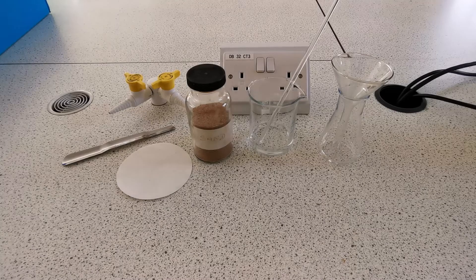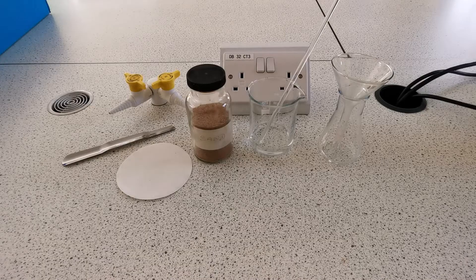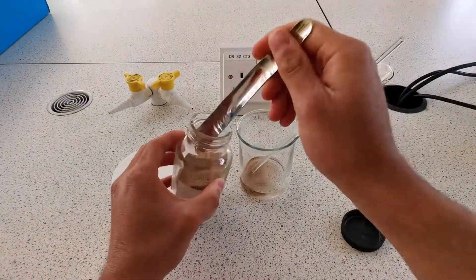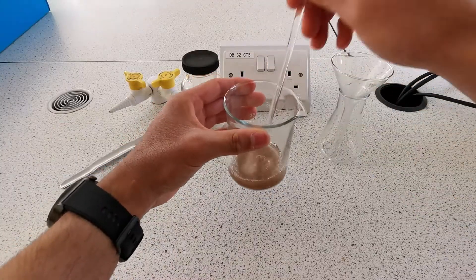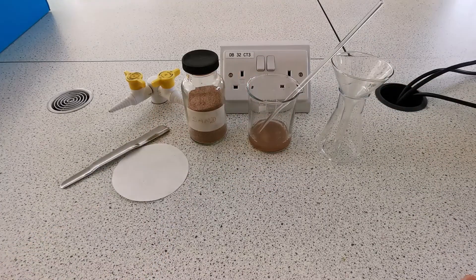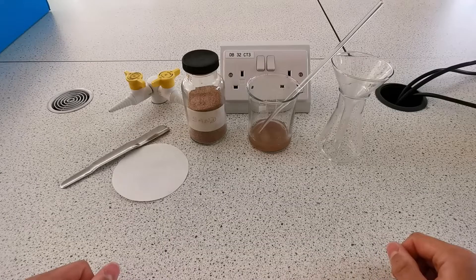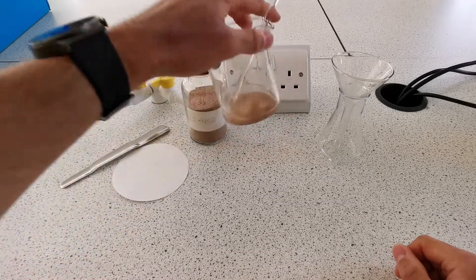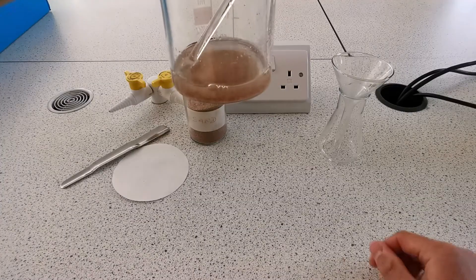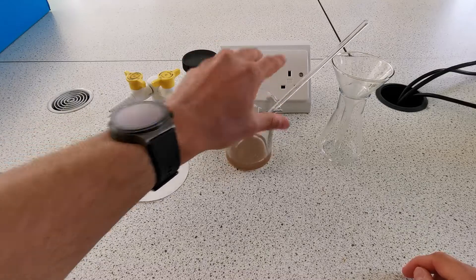This is the equipment we're going to use to carry out filtration today. I'm going to make a mixture of sand and water. Filtration is the separation of an insoluble solid from a liquid or solution, and we can tell that the sand is insoluble because it's not dissolving — it's staying at the bottom. This is the filter paper.